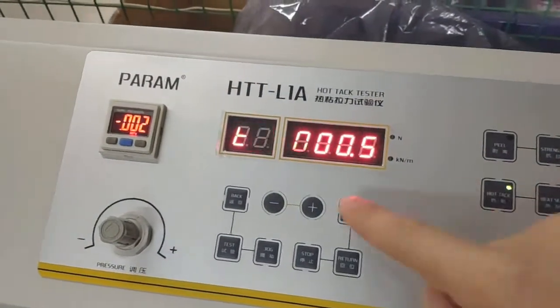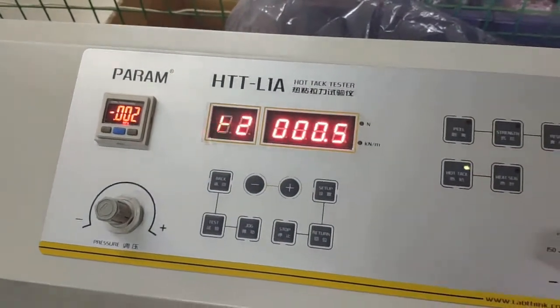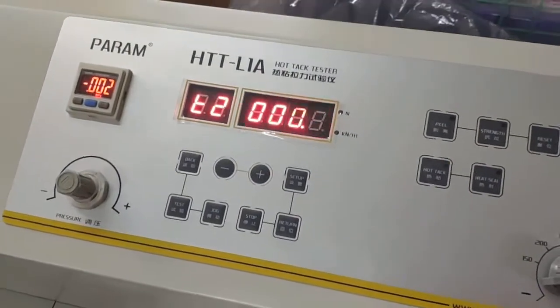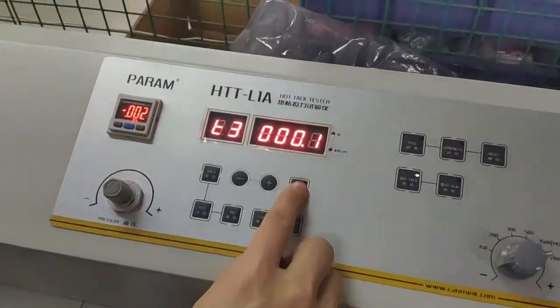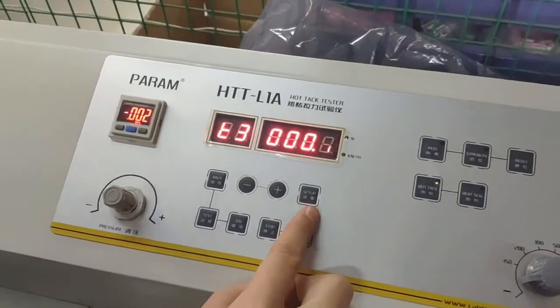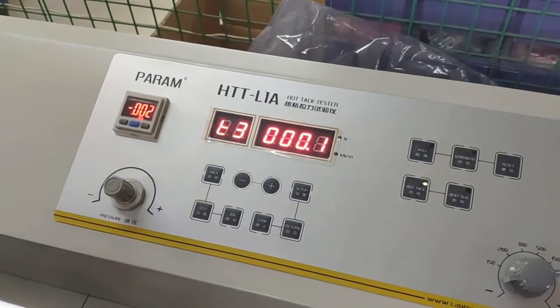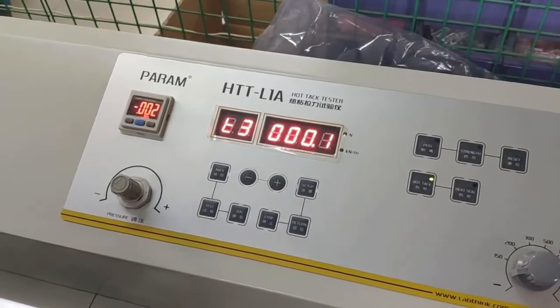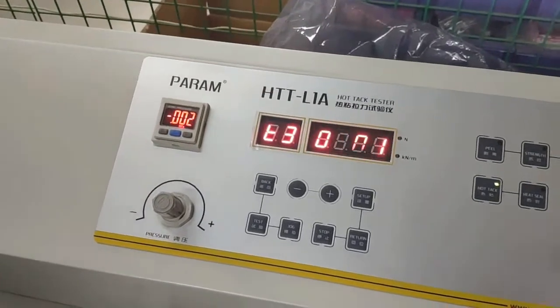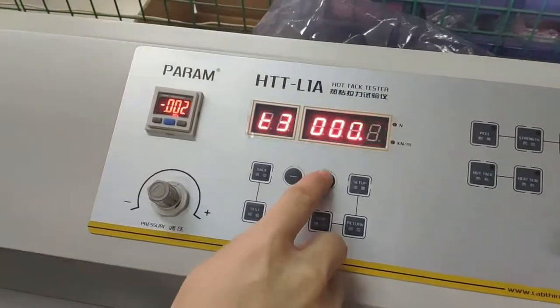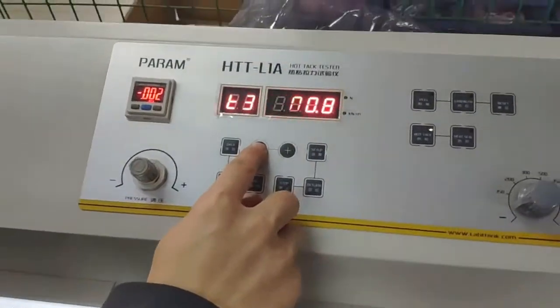Now it is 0.5 seconds. You should adjust the time by the plus or minus button to the expected value. T3 means the cooling time. After the sample is sealed, you have to wait this amount of time to cool it down. This is also according to the standard. Adjust it to what you need.